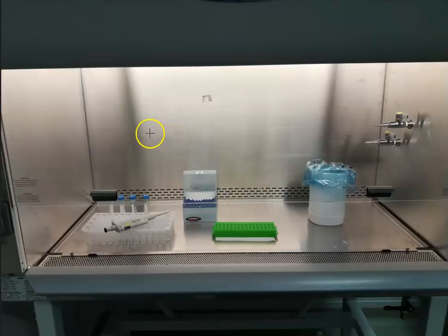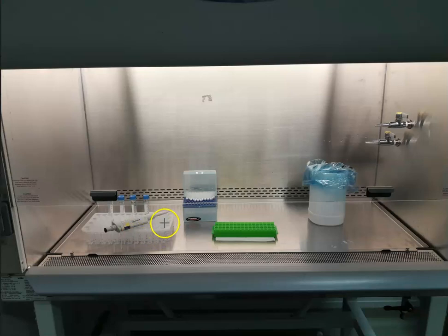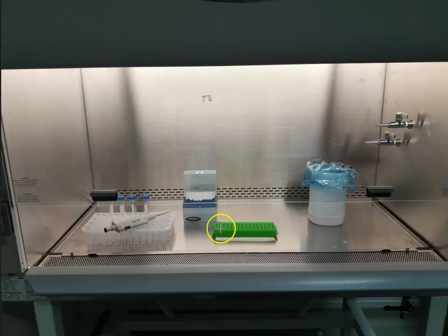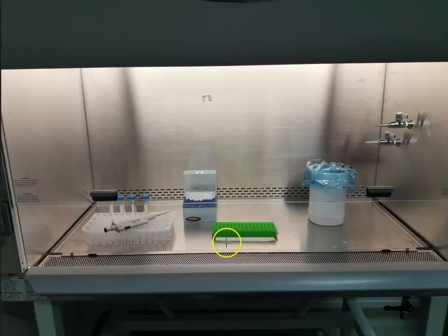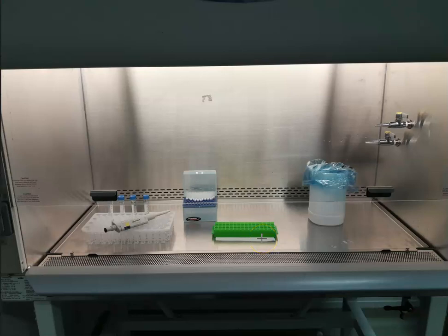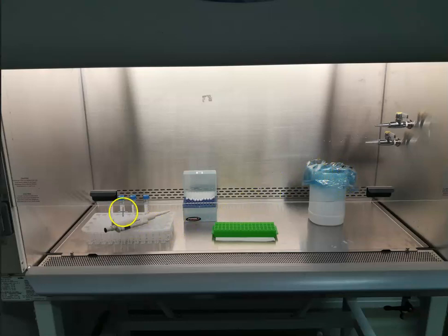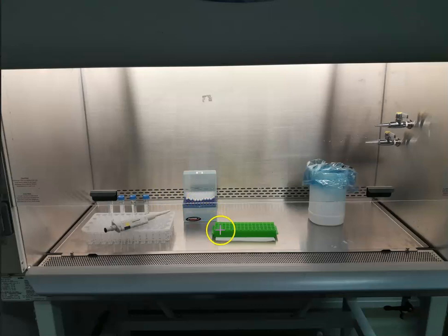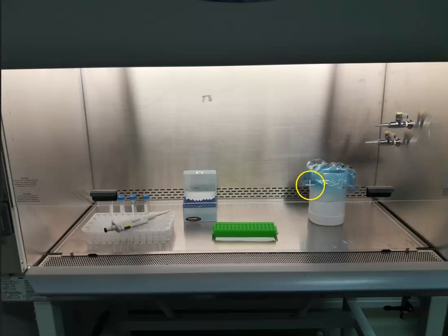This is how a layout looks in a standard biological safety cabinet. You can see a rack containing the samples and pipettes; the pipette tips are located here. Samples are transferred into tubes placed over here, and there is an absorbent towel placed below to collect any liquids which may spill during the operation. Finally, there is a double-bagged waste bin. You take the sample using a pipette tip, transfer it into a second tube, and then transfer the waste tips into the biological waste container prior to disposal.